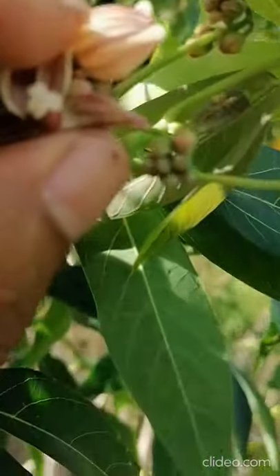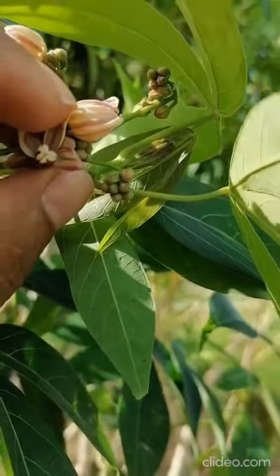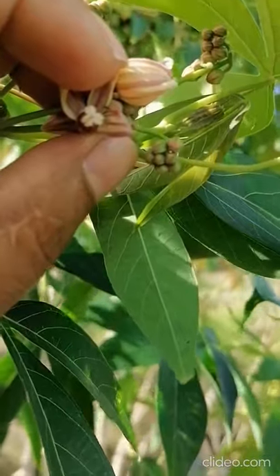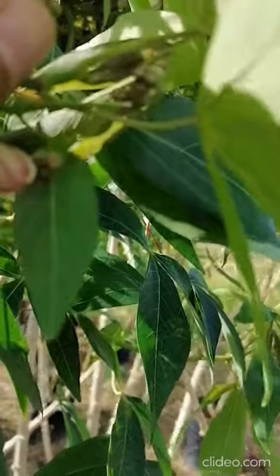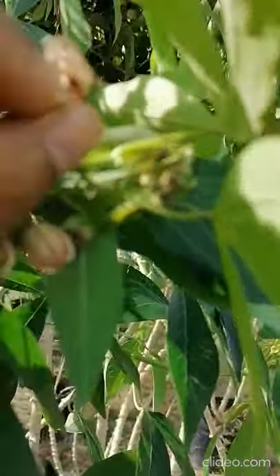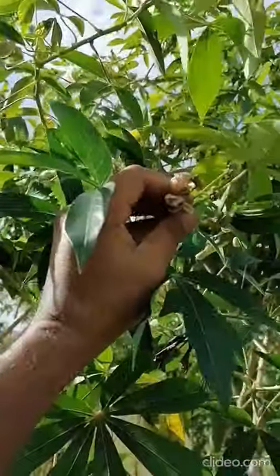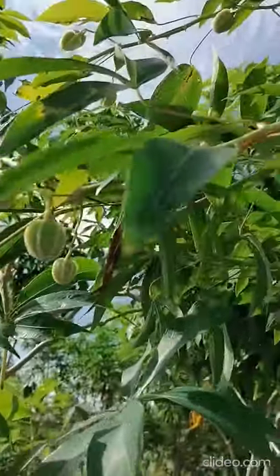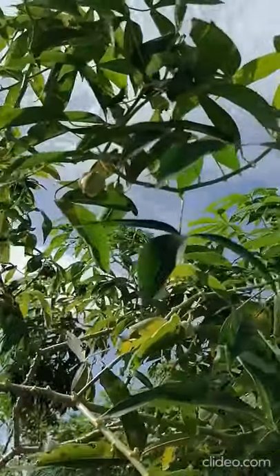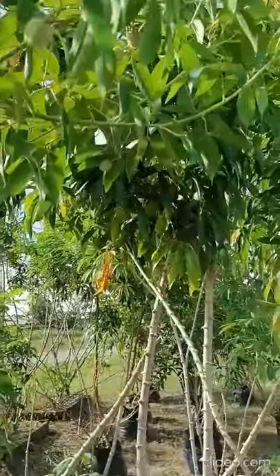You can see clearly this is the stigma, so this is the female flower. All the flowers on this branch are female. After going to the laboratory I will show you more clearly. This is one branch from the same plant — you can see many fruits here already, and this is a new inflorescence with many flowers and fruits.